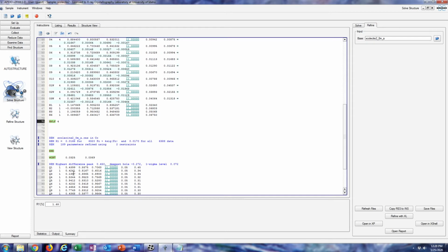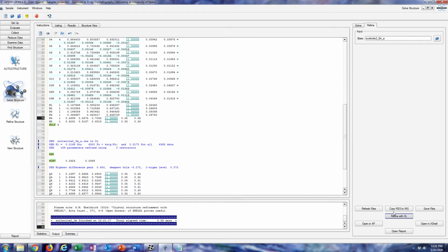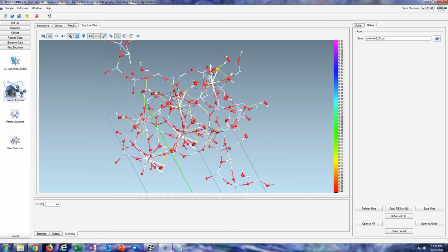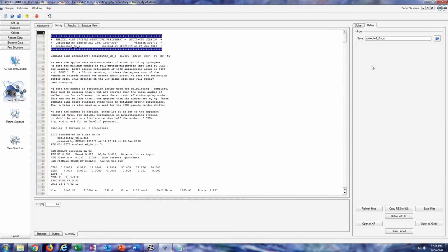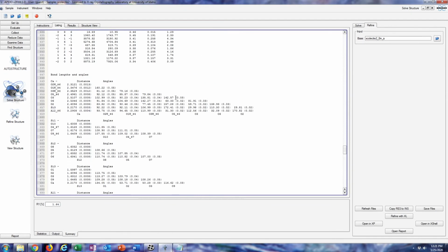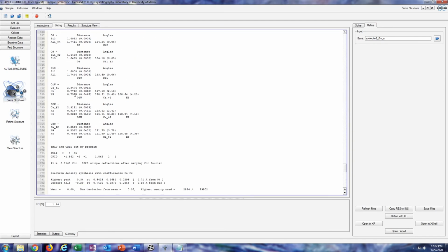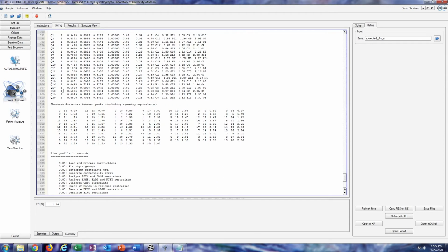So I'll just drag these up here, rename those 4 and 5. And since everything is so stable, I will just refine these without restraints or constraints. Okay, that's looking pretty darn good. But we have to make the bond lengths make some type of sense, because in water, the bond length should be about 0.96 angstroms, I believe. And that's what these seem to be. They're just water molecules that are surrounding those big calcium ions in this very open structured zeolite.